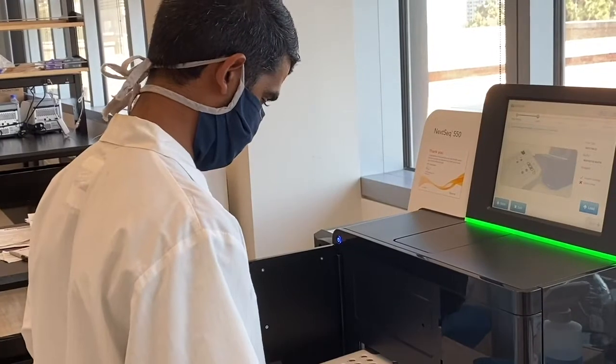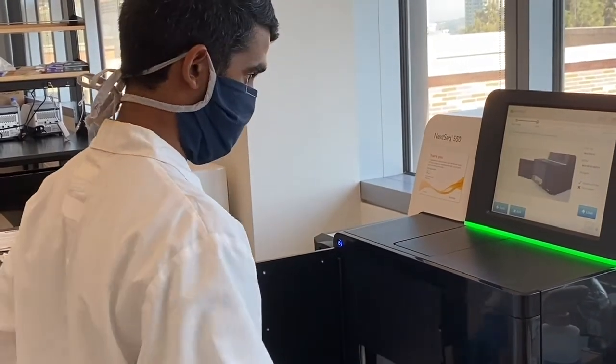Finally, we load the library and the sequencing primers into the sequencing cartridge and start the sequencer.